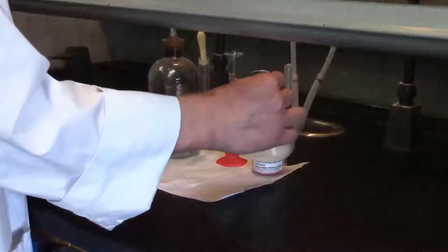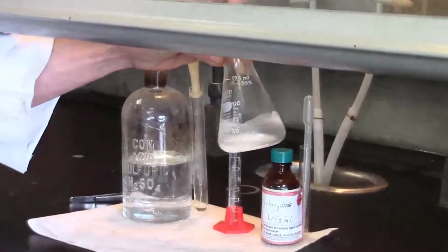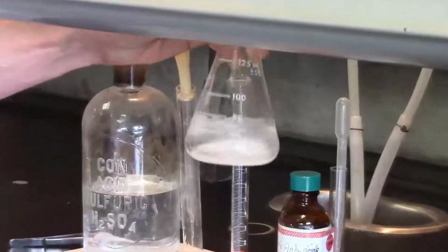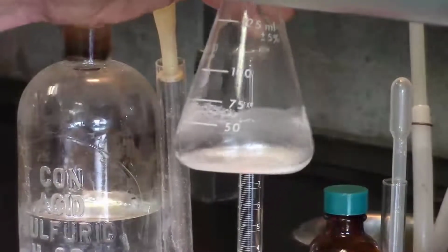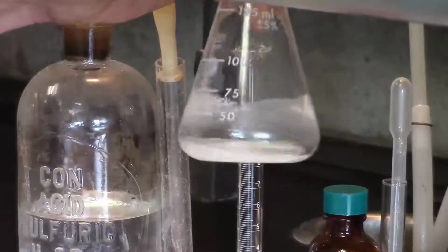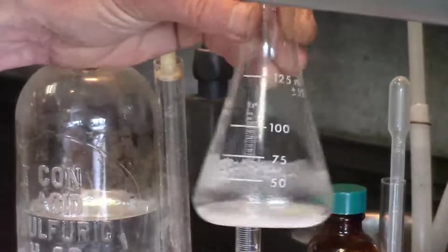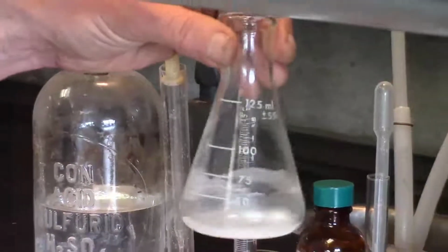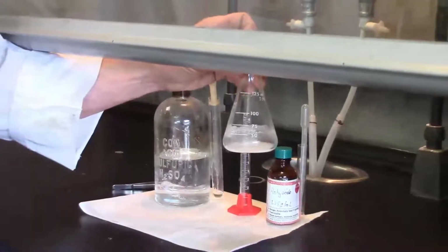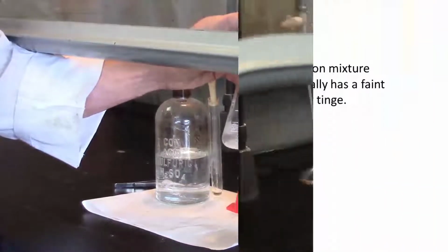Now I'm going to swirl, and you'll see that I still have a milky consistency, but the color has changed a little bit. Now I've done this experiment a number of times. Sometimes at this stage I actually see even a pinkish color. Right now it's kind of yellowish. So what you see exactly will depend on your particular experiment, but it'll range somewhere between a slight yellow to a little bit of a pinkish color. So now let's go back to the bench where we have our hot water bath ready to progress with the rest of this reaction.